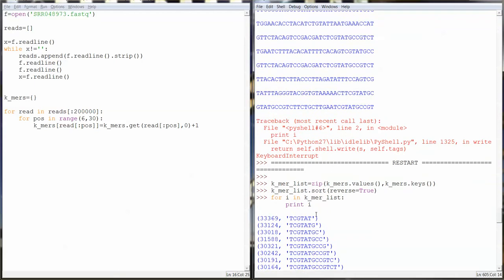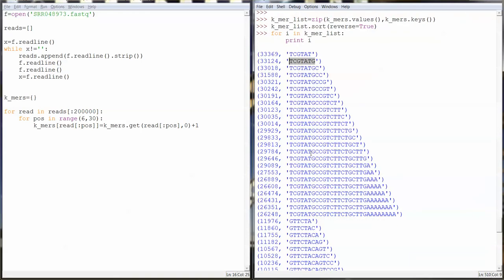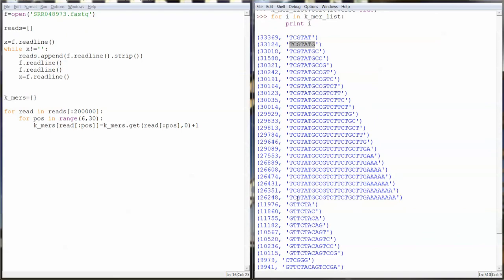So what do we have here? The most abundant 6-mer is this, the most abundant 7-mer is that, and it continues to grow, and then we get a poly A at the end of it. In the first 200,000 reads, this showed up 26,000 times, which is a very high percentage, and then it also ended in poly A. So I would be willing to bet that this is our adapter sequence.